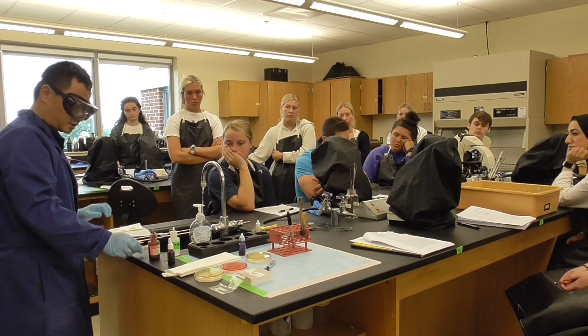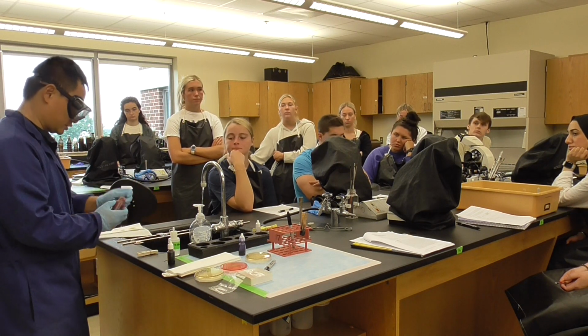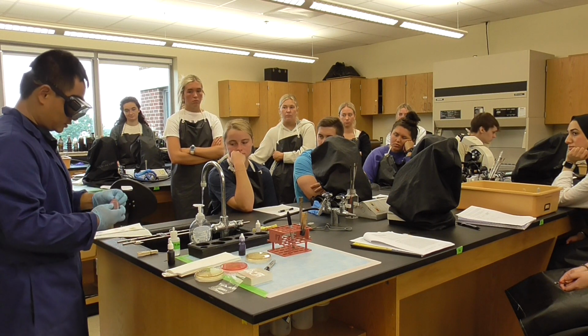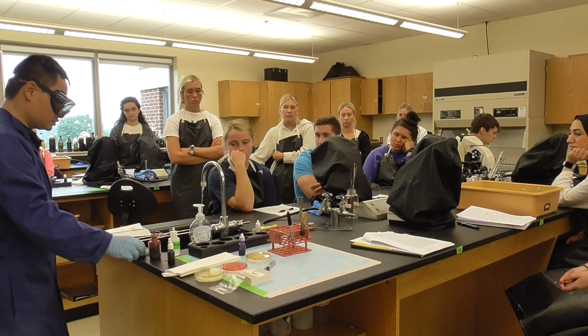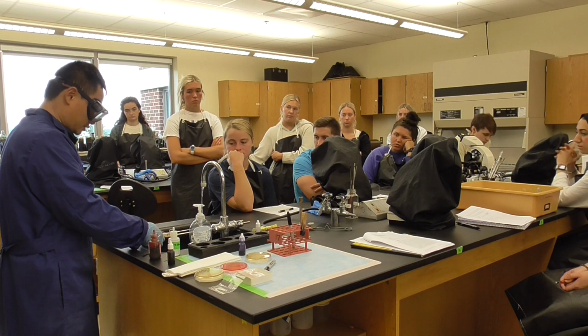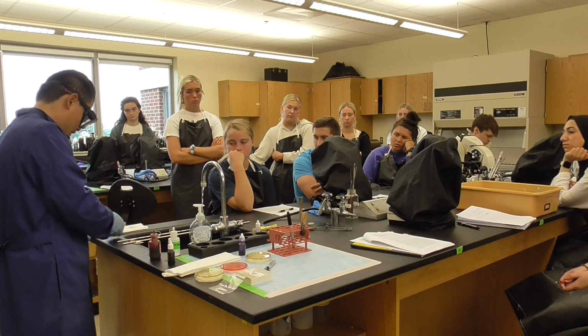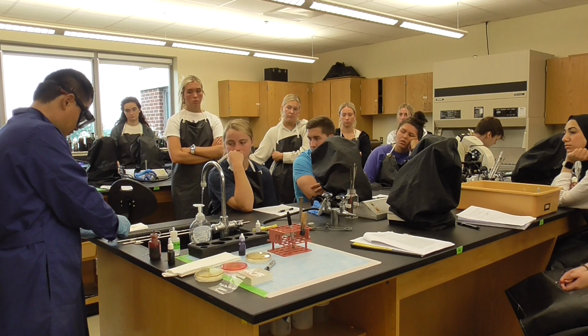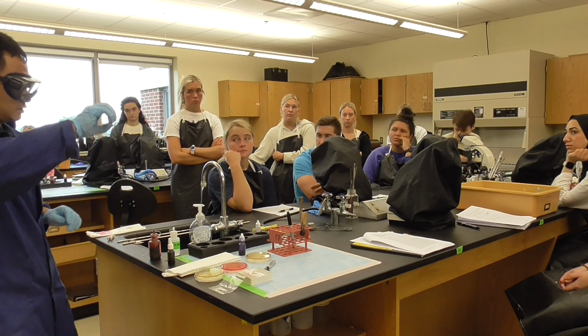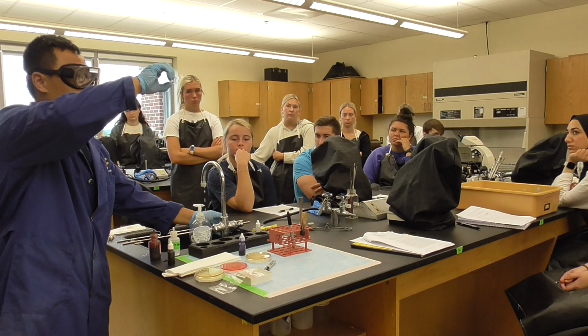And finally, we're going to do the counterstain. The counterstain is safranin. So safranin, we're going to add it right here, and then still 60 seconds. When the 60 seconds is ready, we'll be doing the rinse. Okay, after doing the rinse, just cover it. Now it's ready.